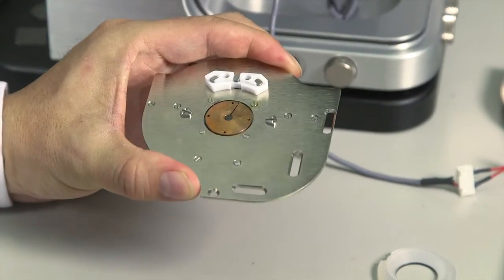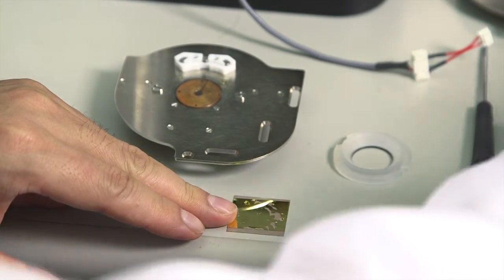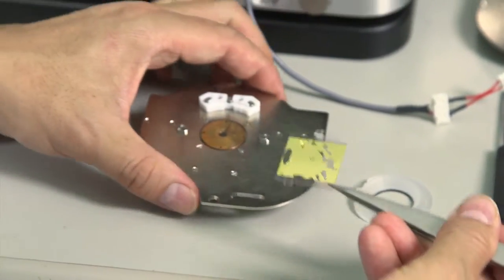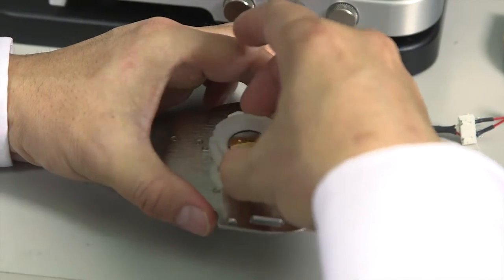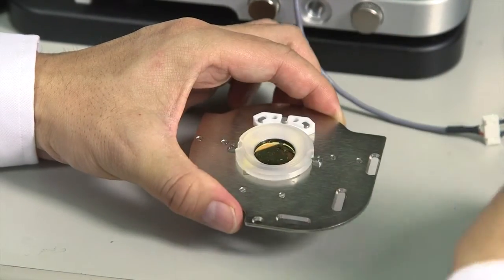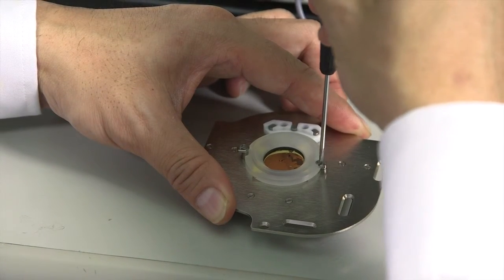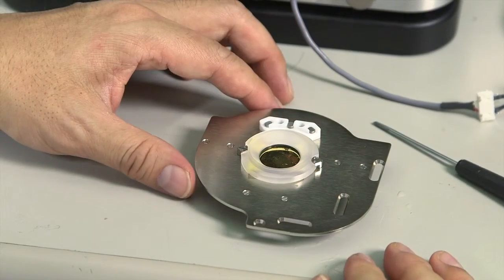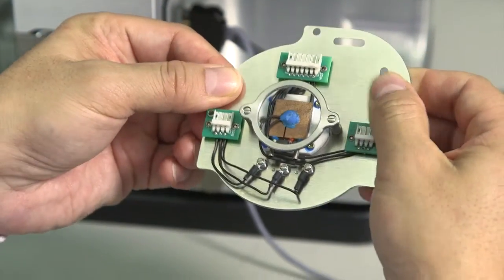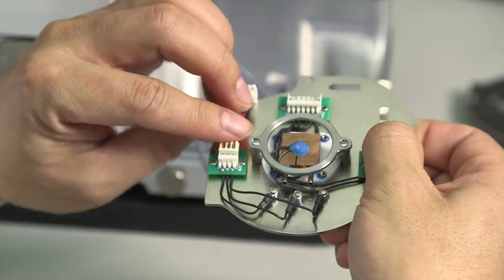MAC sample plate, position the sample in the middle. Add liquid cell. Push down and rotate the two locks. Then on the back side, we need to connect the MAC signal cable, which is a 3-pin plug.